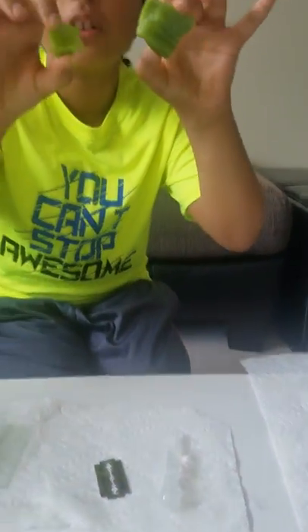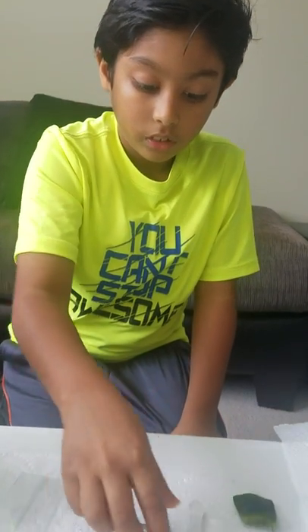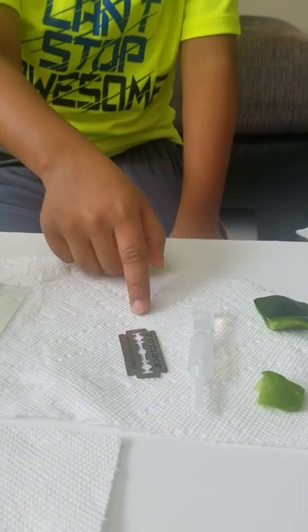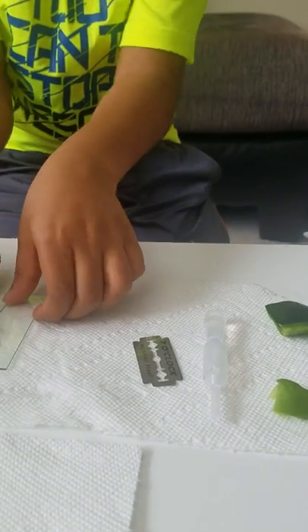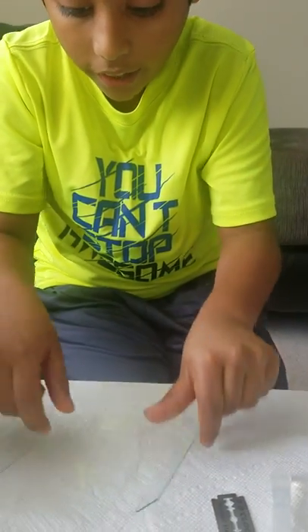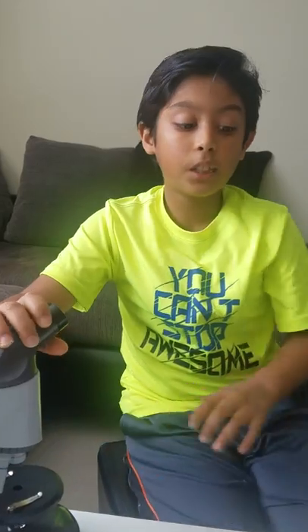What you need are two bell peppers — I got green — a dropper with some water, a blade (only adults should use it, not kids), two slides, two slide covers, and a microscope. We're not using dye because the cells already have their own color from the chlorophyll.